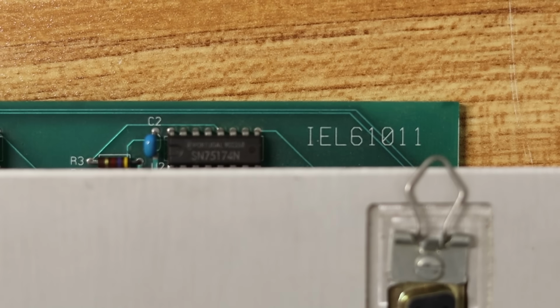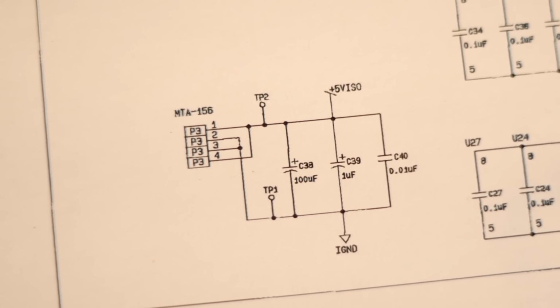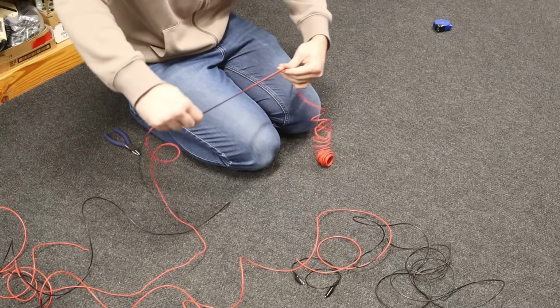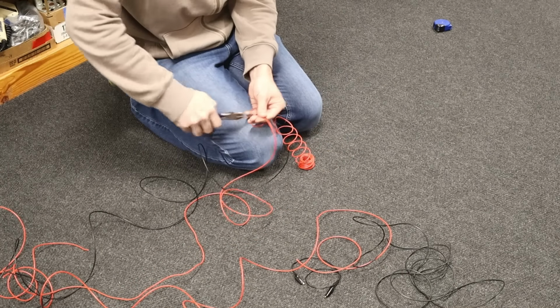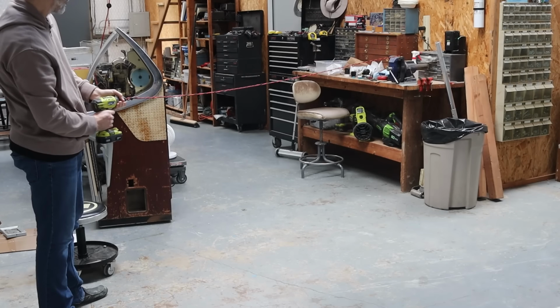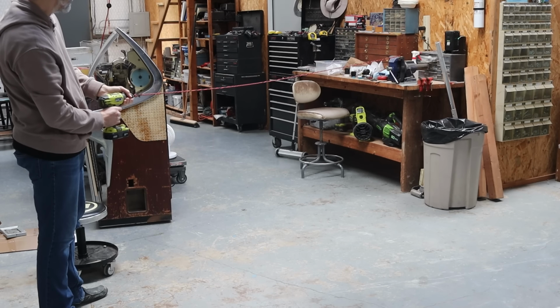And looking at the schematic for this board, it just needs plus 5 volts and ground. Easy peasy. Now, I threw away the old cable because it was in pretty rough shape, so let's make a new cable. I'll measure out and cut some new wires, then clamp one end in the vise and the other in the drill, and just like that, nice and neat twisted power wires.